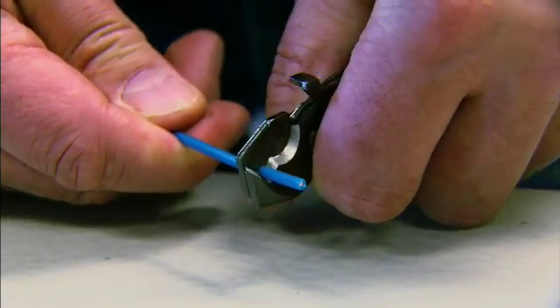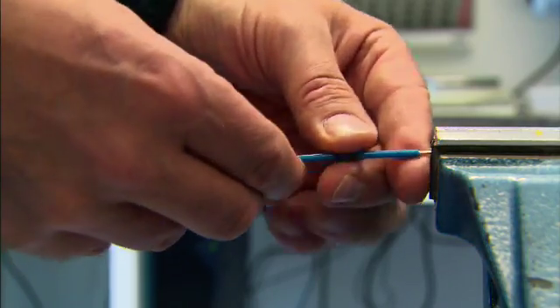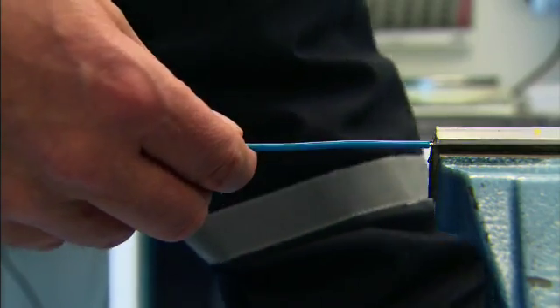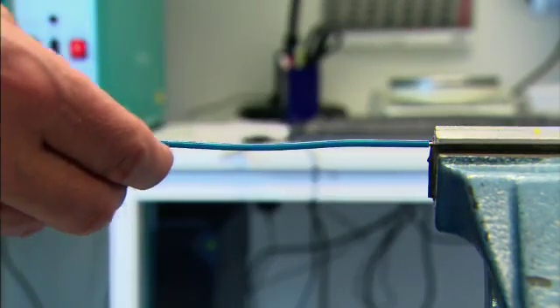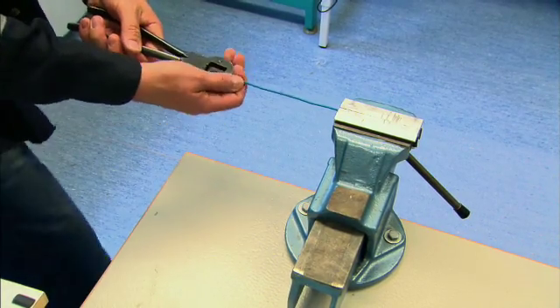We recommend careful sample preparation to avoid failure. The sample surface should be smooth and undamaged. For cables with conductors up to about 16 square millimeters, the tubular cable insulation can be used without further preparation.